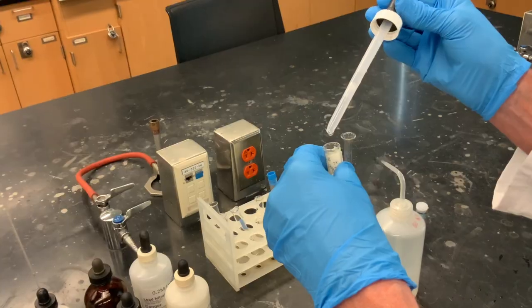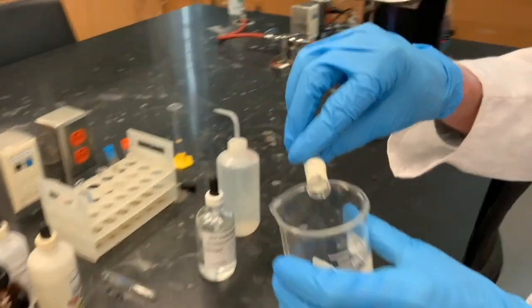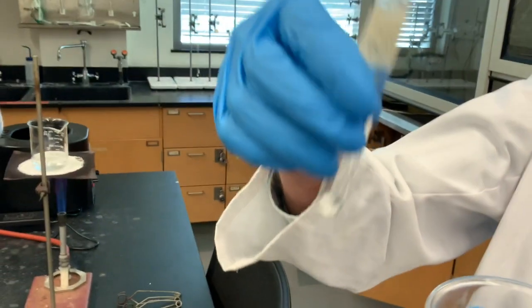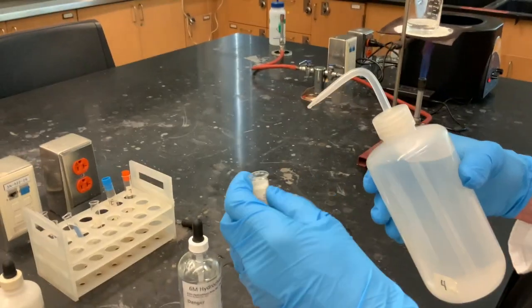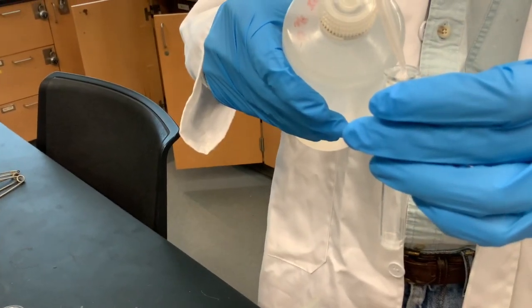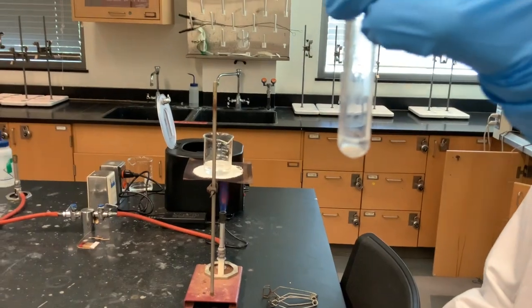We then add another drop of HCl to each sample and centrifuge it again. After this second centrifugation, the supernatant or solution in each test tube is decanted into a waste container. We then wash the precipitate with water to remove any contaminants that may be trapped in the precipitate. This is done by adding water, stirring the contents of the test tube, and centrifuging. The supernatant is again decanted into waste.